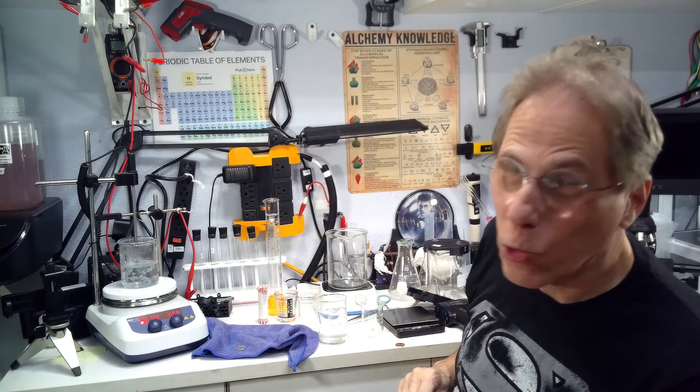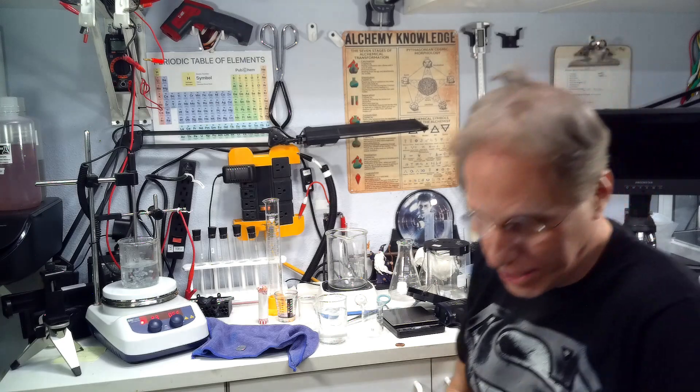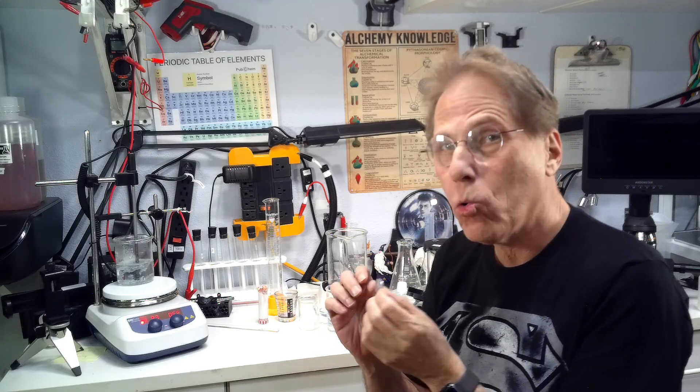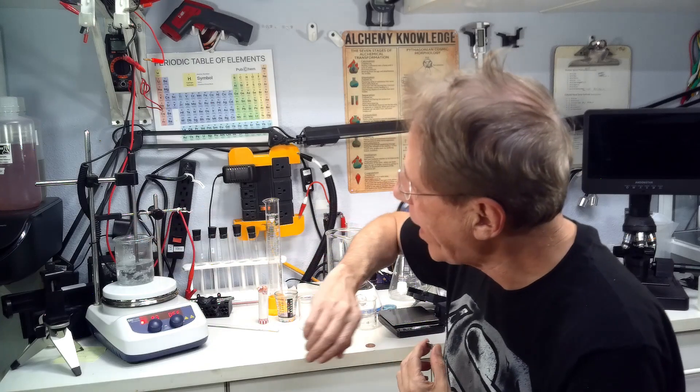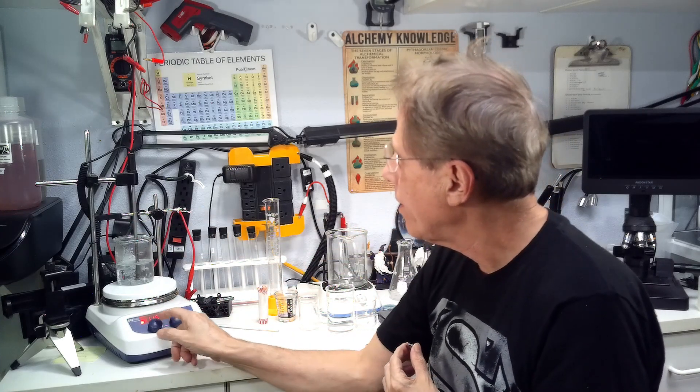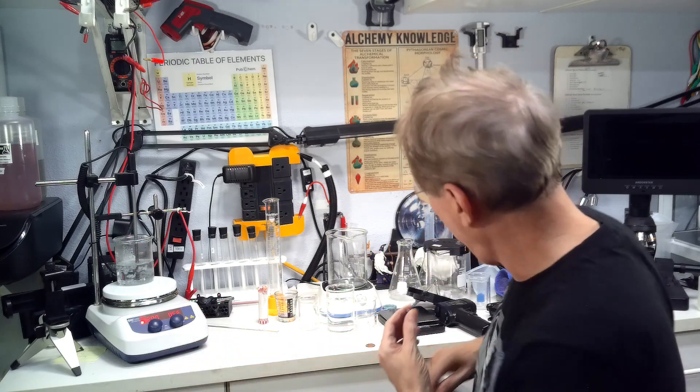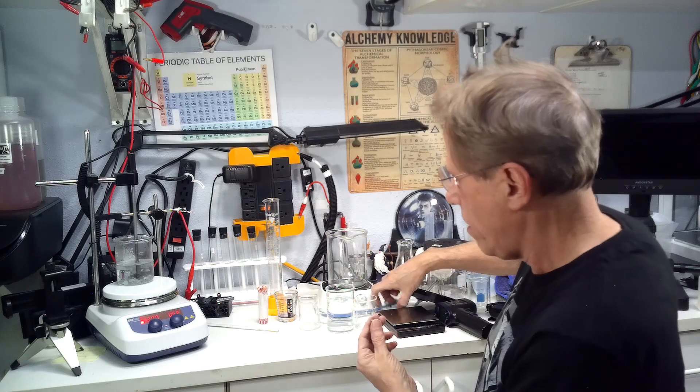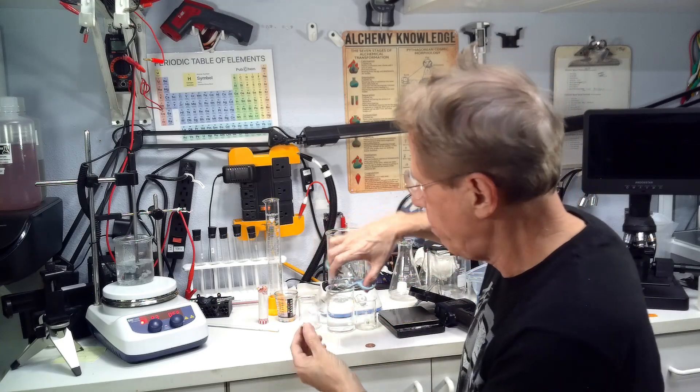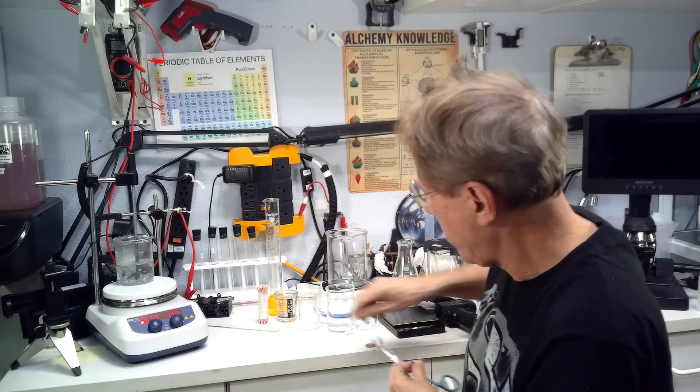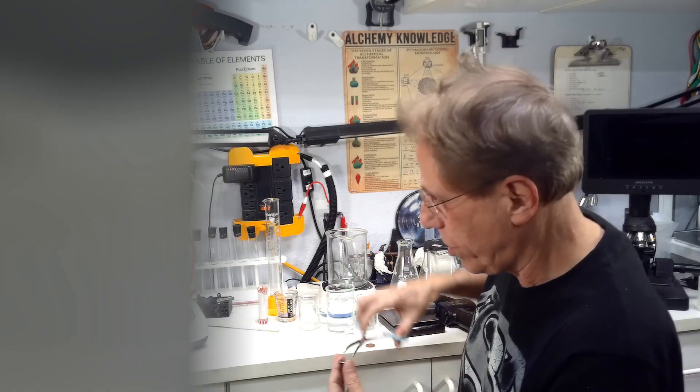Well, not really gold, but I'm getting ahead of the story, ain't I? Okay. Now, to turn this zinc coated penny into a seemingly gold coated penny, we're going to heat it up. I've pushed my beaker to the back here and I'm still cranking the heat over here. I'm going to crank it up even higher and we're going to take the penny and put it on the plate of the magnetic stirrer and heat it.